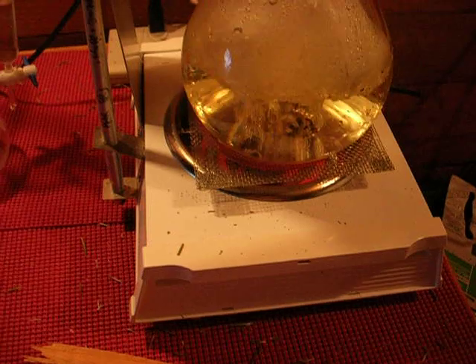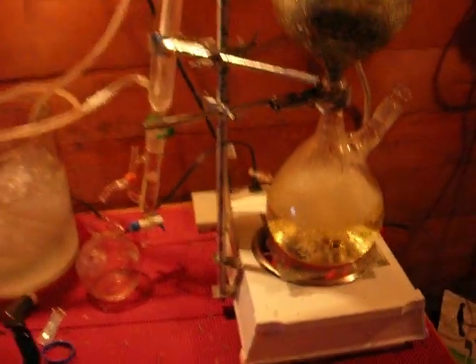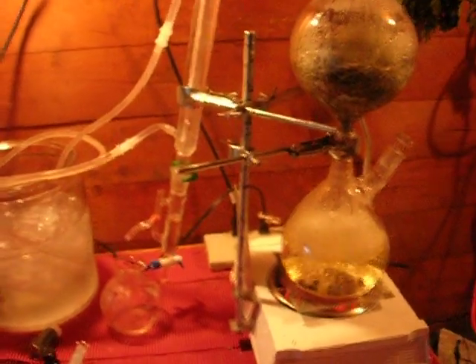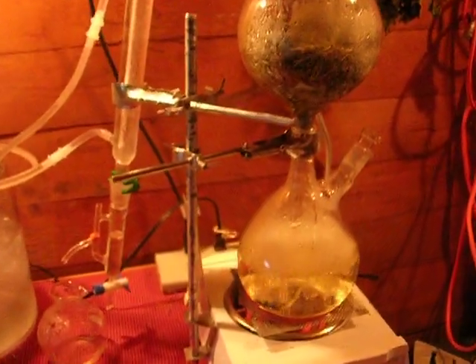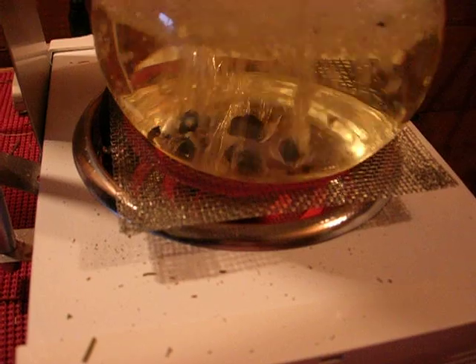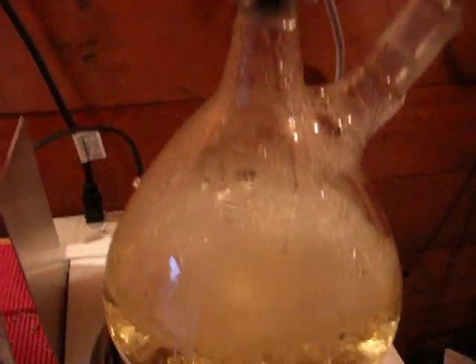What you're seeing here is essential oil distillation of rosemary in progress, and I'll walk you through the process. This is the steam flask, and you could put a couple little rocky particles in the bottom to promote even boiling. The steam moves up the steam flask to the biomass flask, and there's a whole bunch of rosemary from my yard in there.